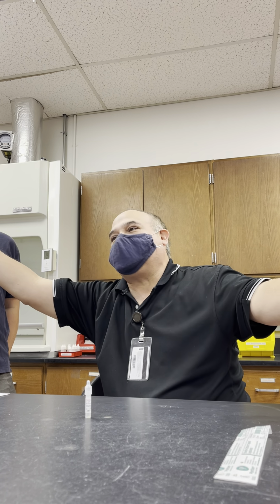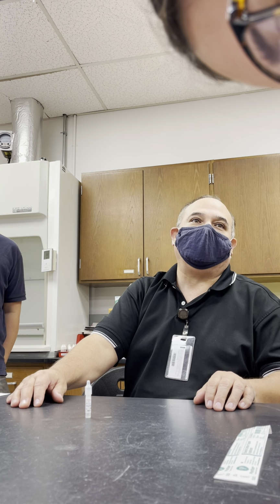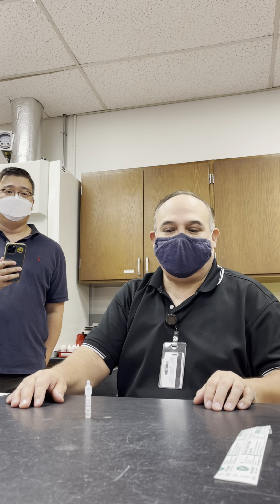It's a big old gigantic word, right? On a practical, if I ask you what the reagent for the oxidase test is, your response should be the oxidase reagent, okay? Because I'm not going to have you know this big old gigantic word. It's not necessary. Good?